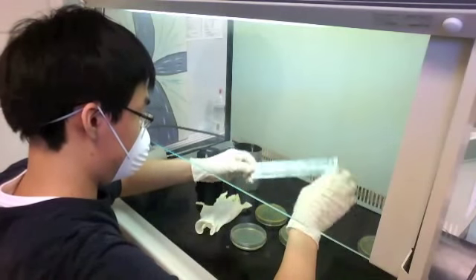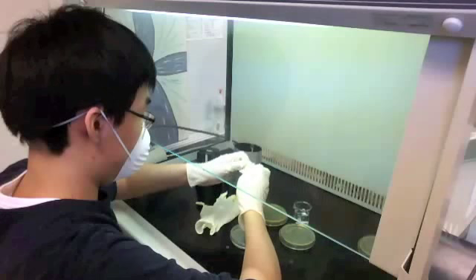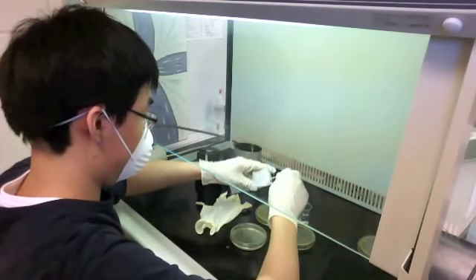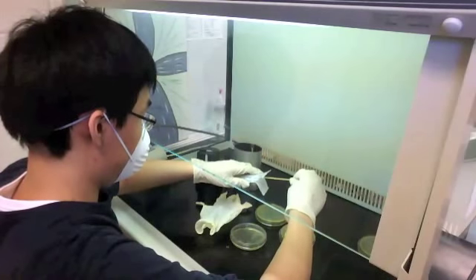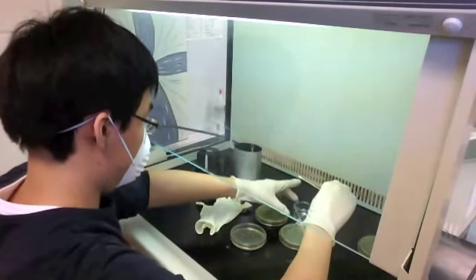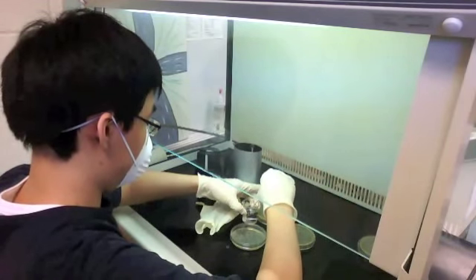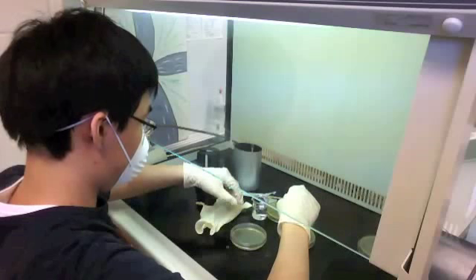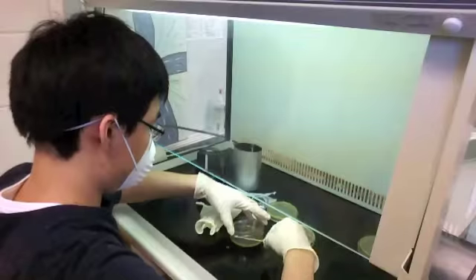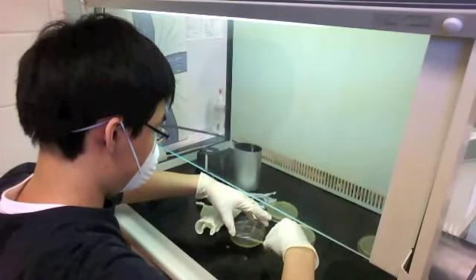I'm opening the cotton swabs — there are two in each one — and taking my time to take one out, which is a little difficult wearing rubber gloves. Now I'm taking a small sample of the distilled water I'll use for the rest of the experiment and carefully plating it onto that specific petri dish. You'll notice I'm lifting the cap just ever so slightly — again, that's to reduce any bacteria getting onto the agar and contaminating that plate.